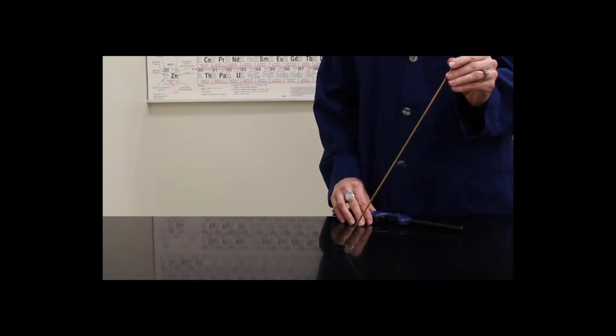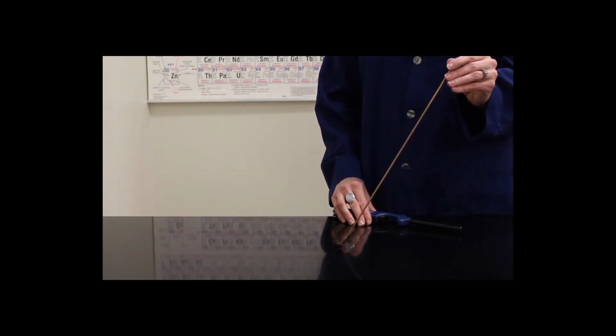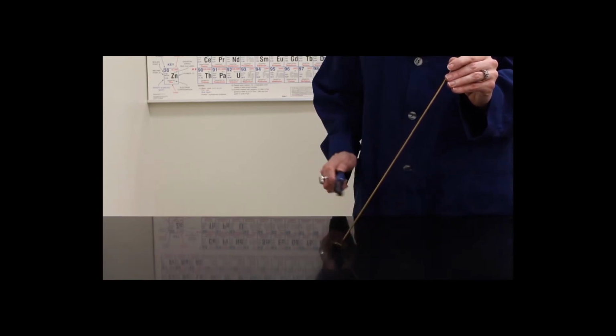This demonstration involves heats of reactions, and what we're going to be doing is we're going to burn 4 different substances, which is considered a combustion reaction. Combustion reactions are exothermic and they release heat. Each of these substances is going to release a different amount of heat or have a different heat of reaction, which we're going to correlate to the size of the flame.